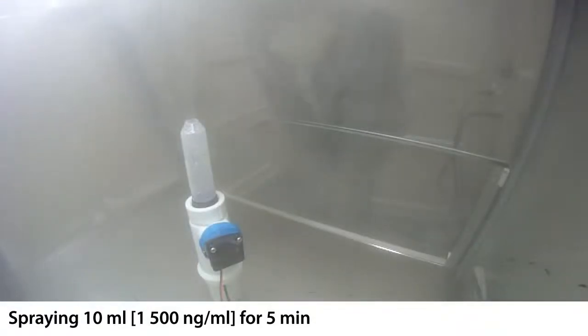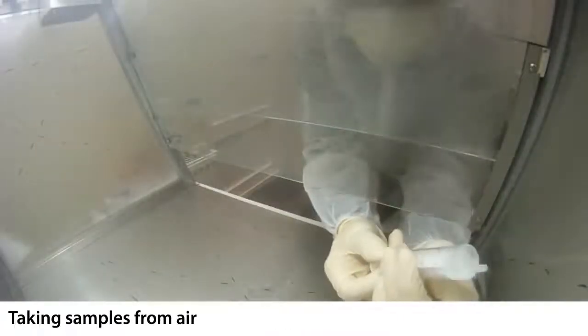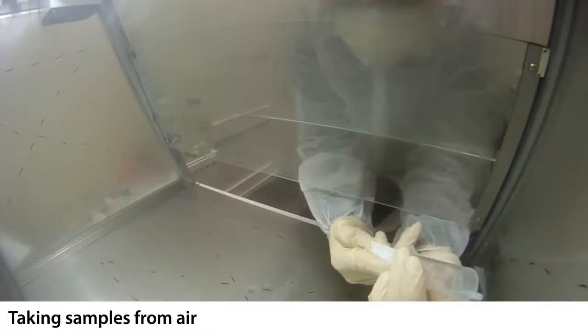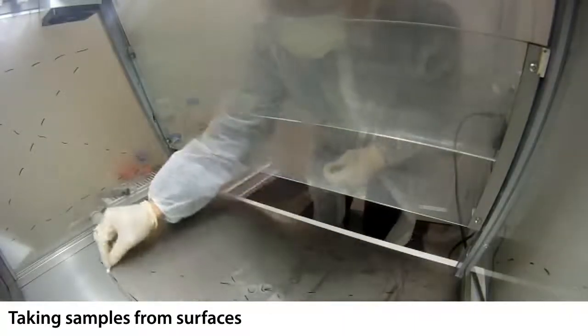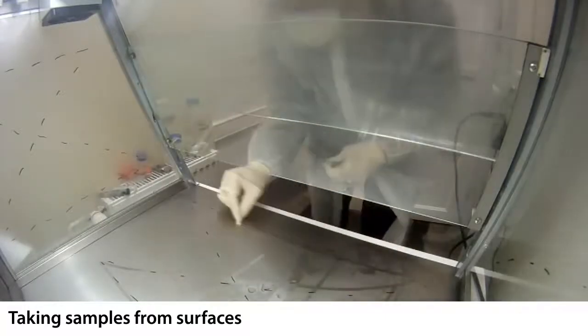Then we are going to put a nebulizer inside the cabinet and spray lambda DNA phage. Three samples are taken from air with syringes. Four samples are taken from surfaces with smears.